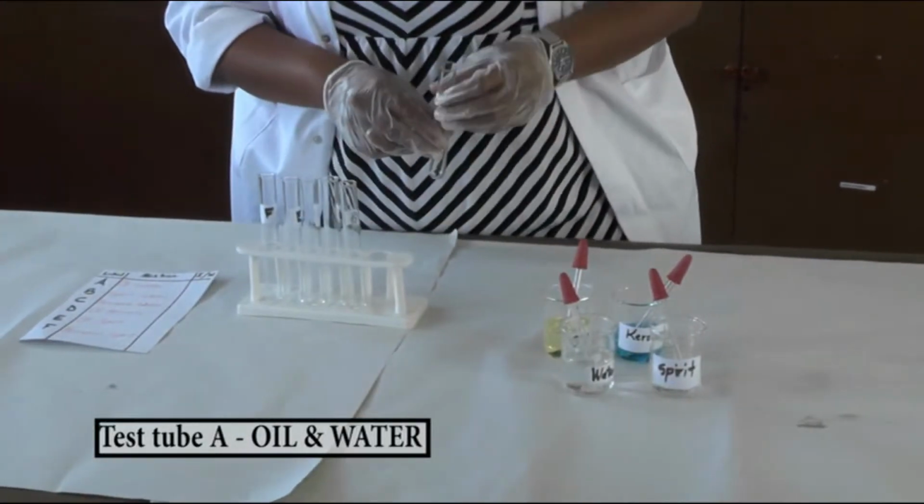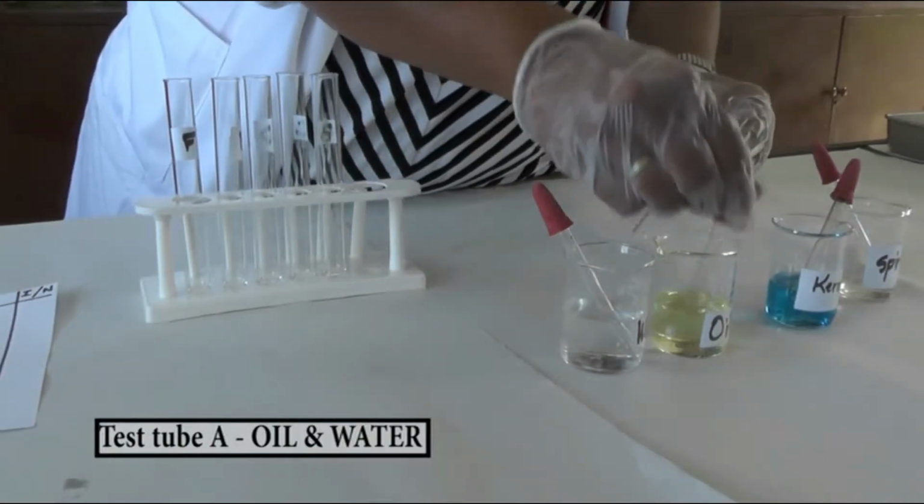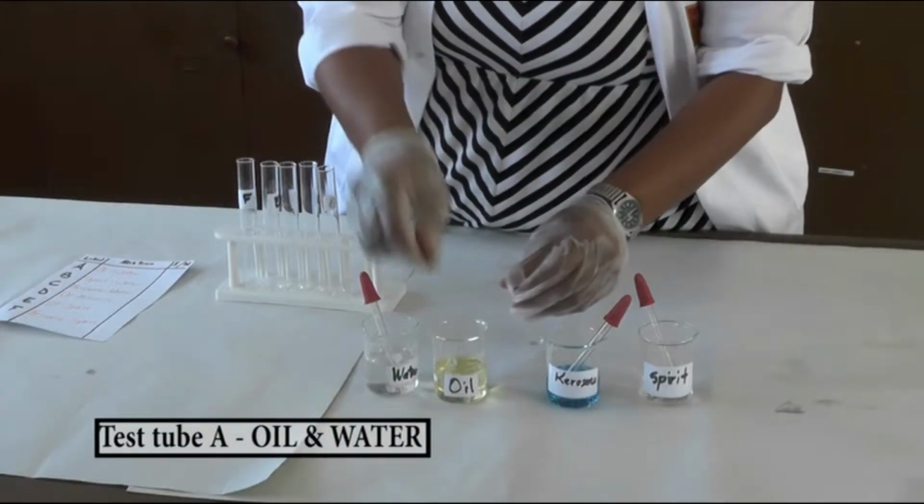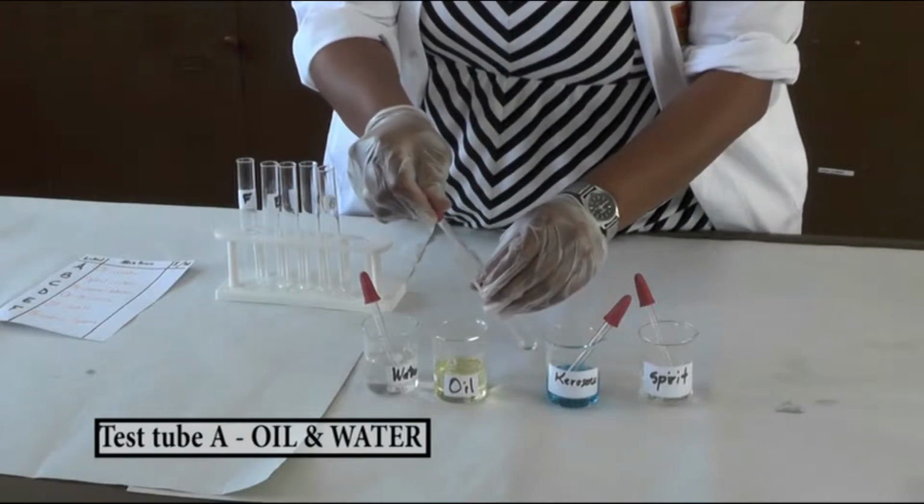In test tube A, mix oil and water well by shaking the test tube a little and then place the test tube back on the rack.